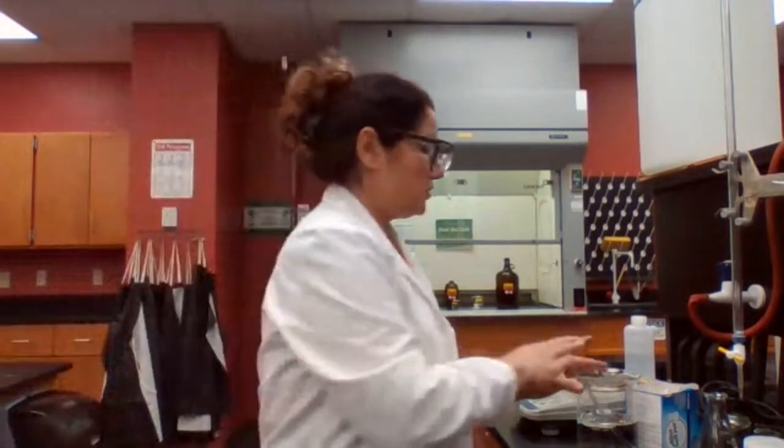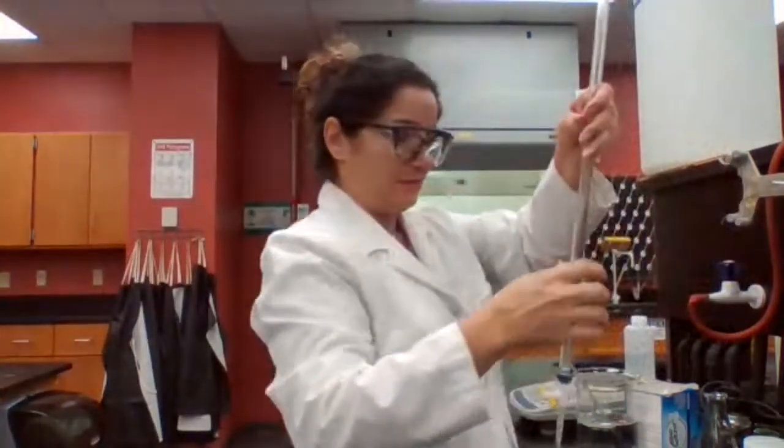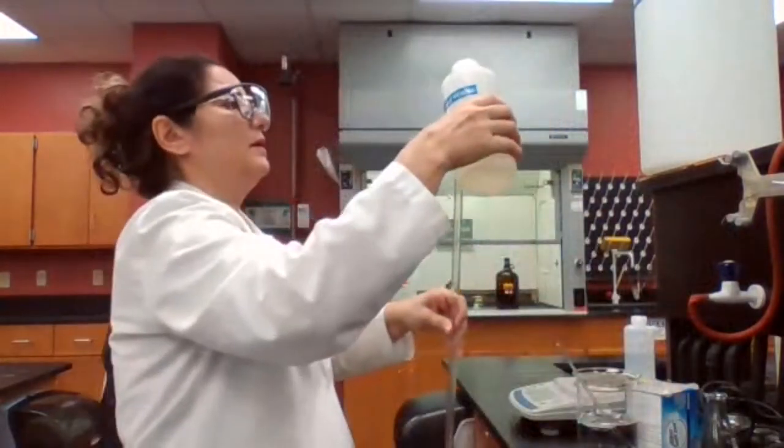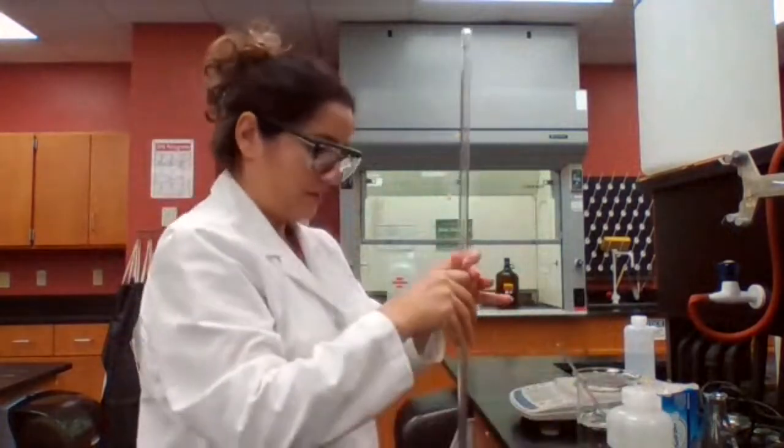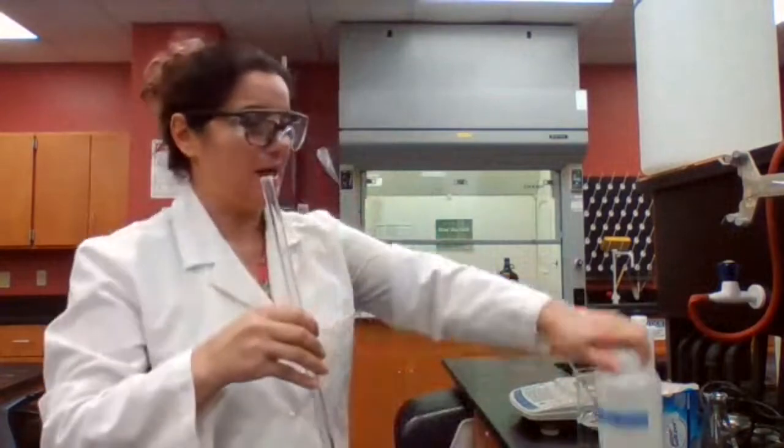You want to fill up the burette with the sodium hydroxide solution. Now, one can assume that burettes are clean, but someone else is not going to trust the people who used it before.